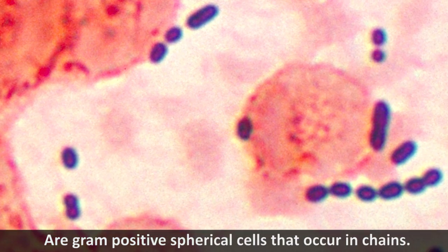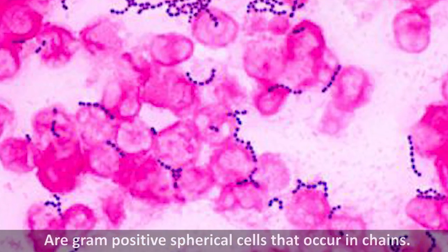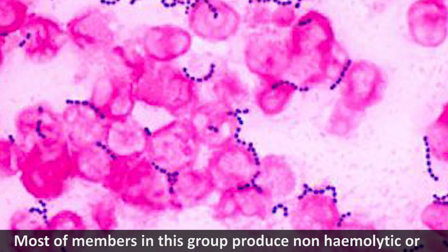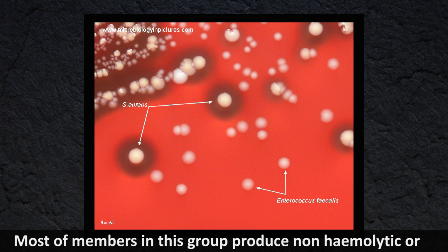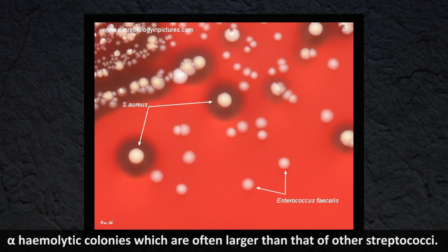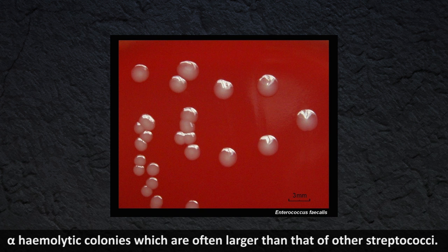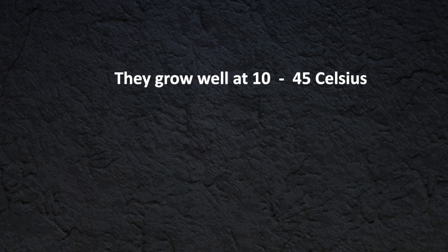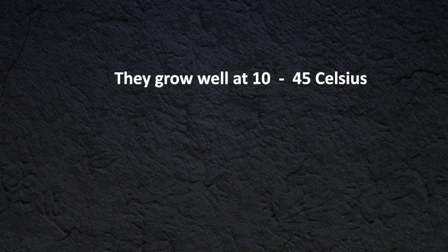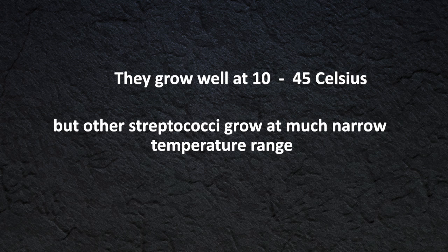Enterococci are gram-positive spherical cells that occur in chains. Most members in this group produce non-hemolytic or alpha-hemolytic colonies, which are often larger than those of other streptococci. They grow well at 10 to 45 degrees Celsius, whereas other streptococci grow at a much narrower temperature range.